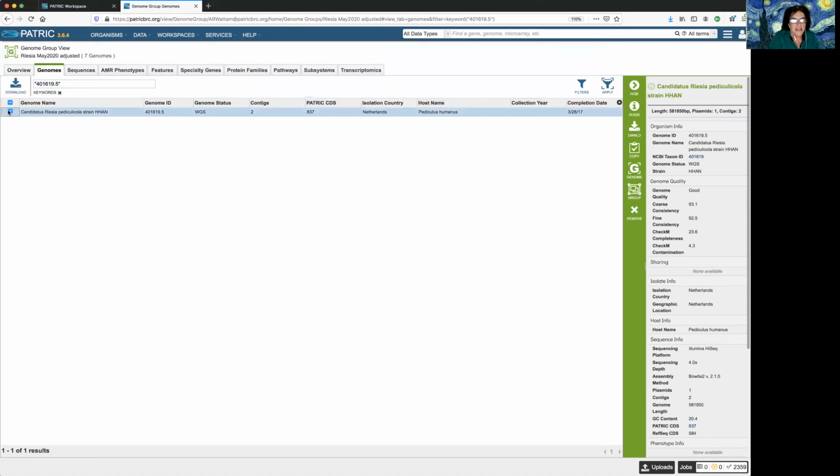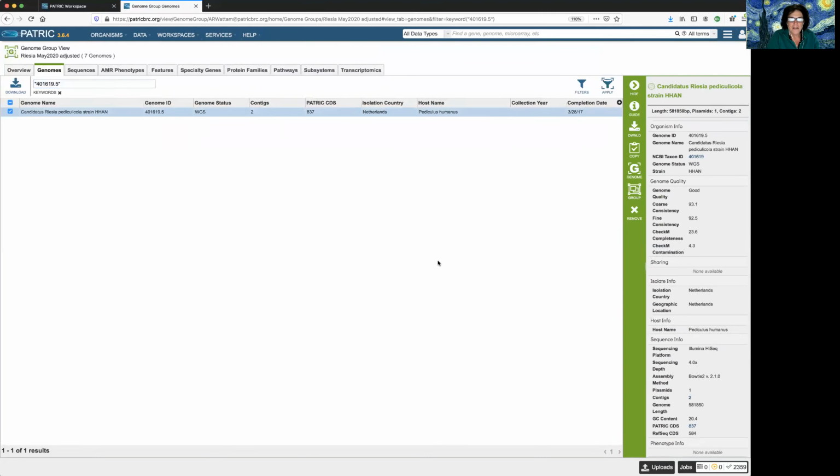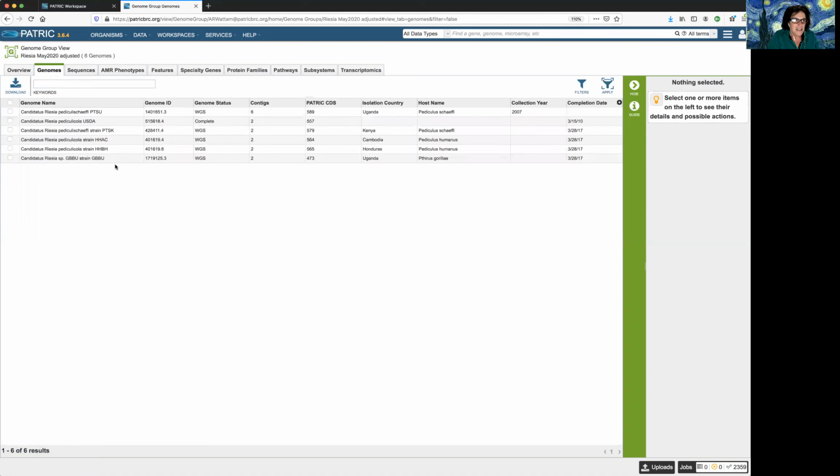We want to get rid of that. So there it is. I click the remove icon after highlighting the row, remove it. You sure you want to remove this one genome from the group? I do indeed. Okay. And then it'll pop up a message and say, it's gone, you did it. And to verify, you click the X next to keywords, and now we're down to fewer. So right away, we can see that with these particular guys, I've gotten rid of 2 of the genomes that are problematic.